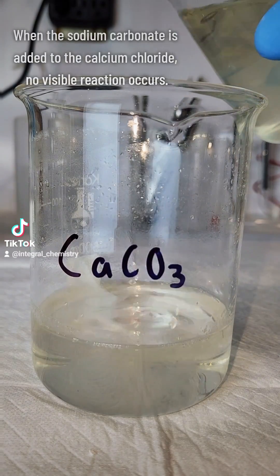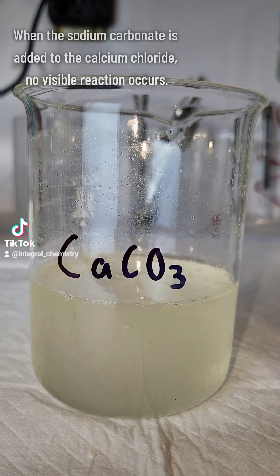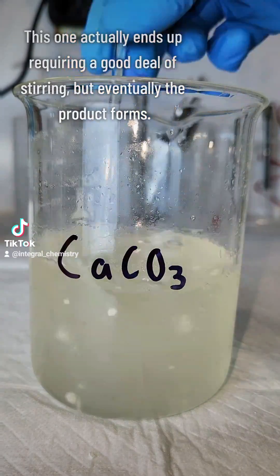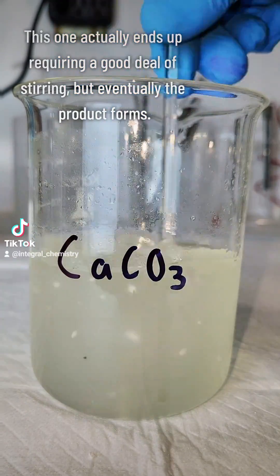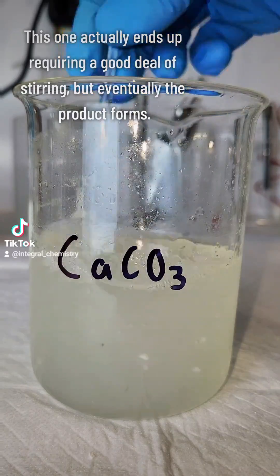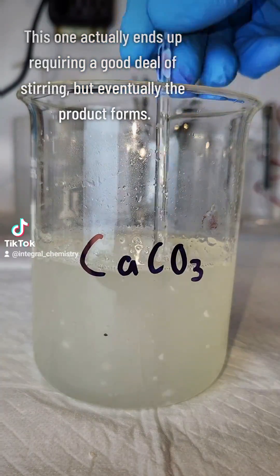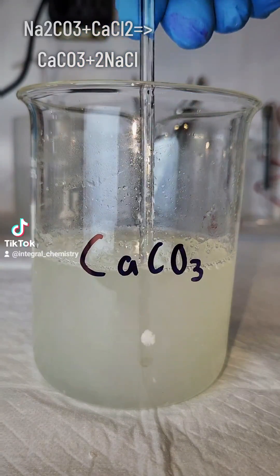I next move on to my calcium carbonate, and I do it the same way by pouring the sodium carbonate into my calcium chloride solution. You'll notice a precipitate doesn't immediately form in this one, and it actually takes a good deal of stirring to get this reaction to go to completion.